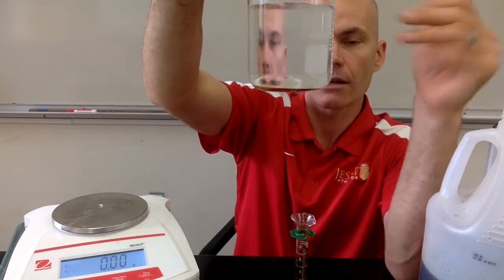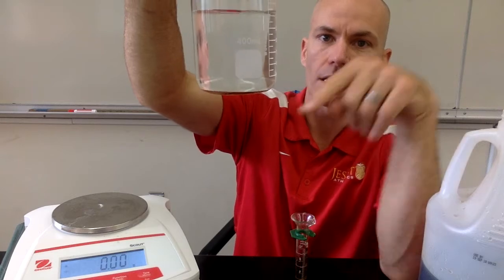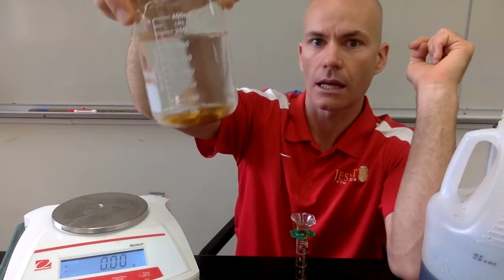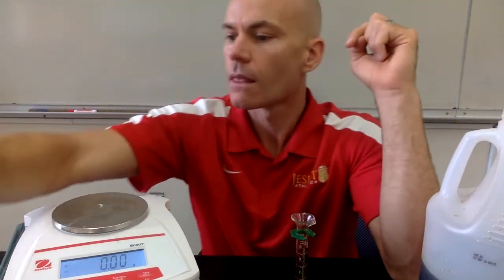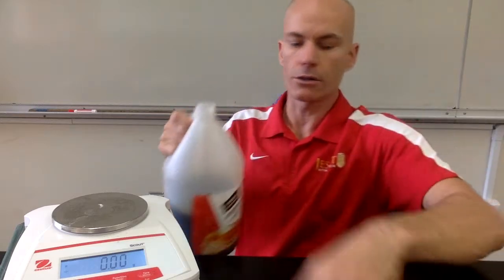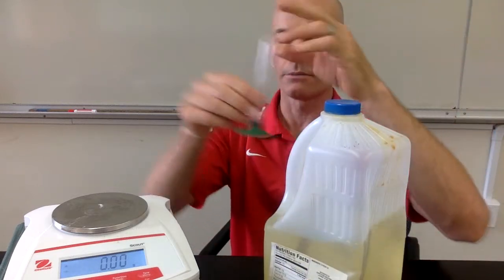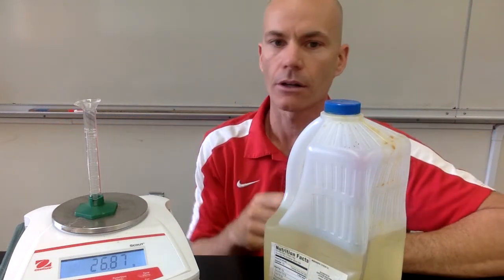So you guys were able to calculate the density of water. You're able to calculate the density of the syrup with the data that we just collected, and you can see that the syrup sank in water. All right, let's continue. Let's do this for a couple more substances and see if we can draw any conclusions. Get the syrup out of the way. So the next thing I have is vegetable oil. So I've got a container of vegetable oil. I'll get a new graduated cylinder.